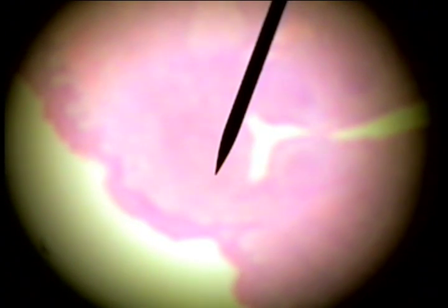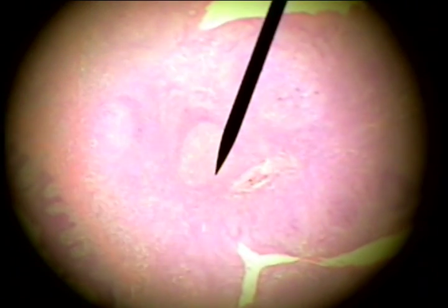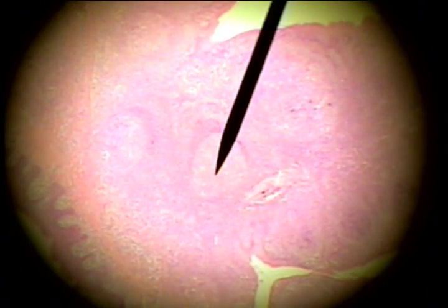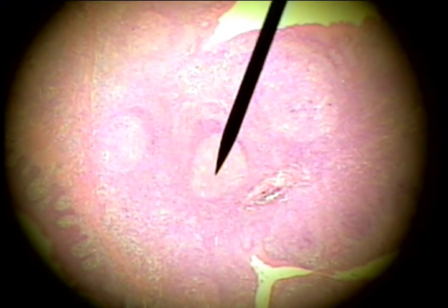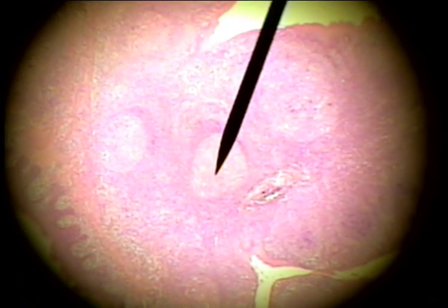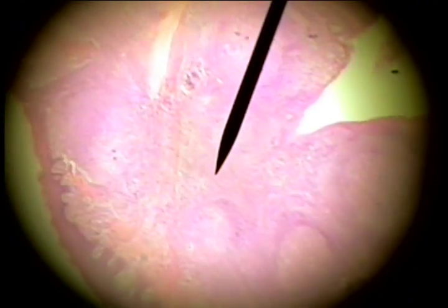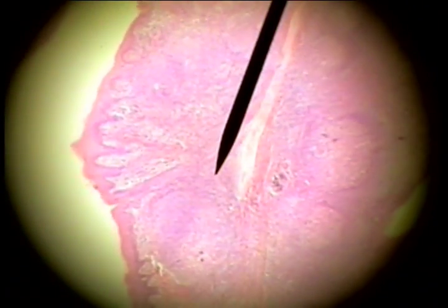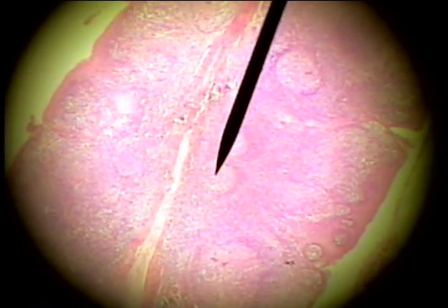If we go back to low power and look beneath the surface of the epithelium in the connective tissue, we see lymphatic nodules. These nodules have a lighter center and a darker corona. This is the germinal center of a lymphatic nodule, and this is the corona. They are scattered under the surface of this palatine tonsil epithelium.